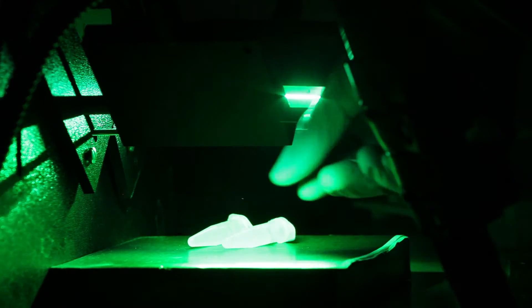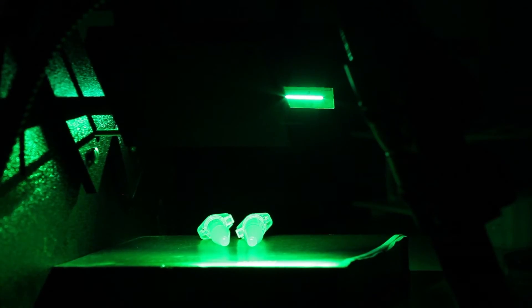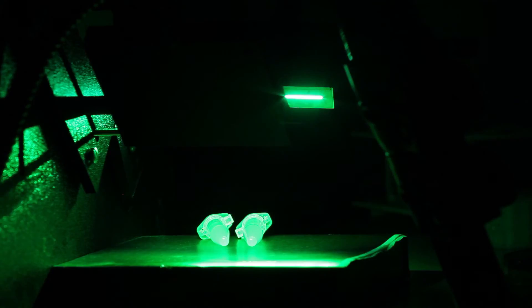So the final thing that I'll load on here are our two 1ml aliquots of cells that we prepared, S27 and S28. And you can clearly see a very strong fluorescent signal that is specific to the S28 strain. So this is the same fluorescent signal that the plate reader is going to read, although in a quantitative way. And when we take this fluorescent signal and divide it by the absorbance or the OD of the strain that we loaded onto the plate reader, we'll get a quantitative measurement of the fluorescence per cell.